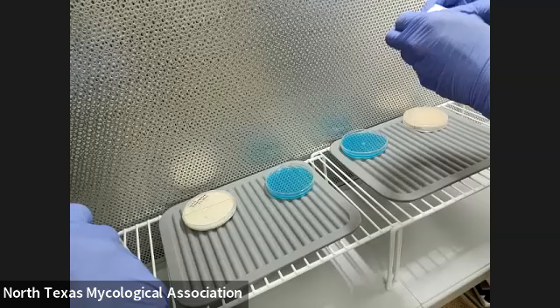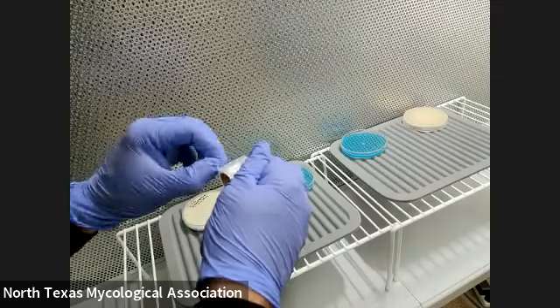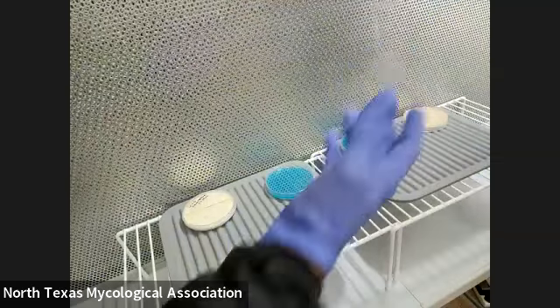I'm trying to find the opening to the cling wrap. It's hard with gloves on. Oh, there we go. So we found the little opening.